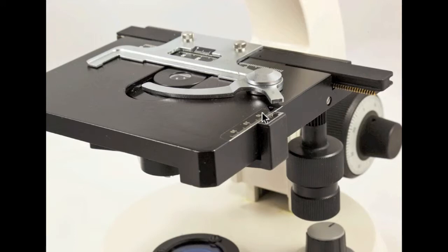There are even scales for the x- and y-axes that can be used to relocate objects on a microscope slide.